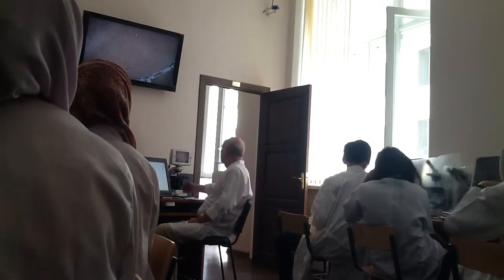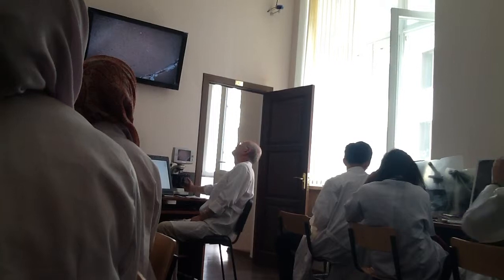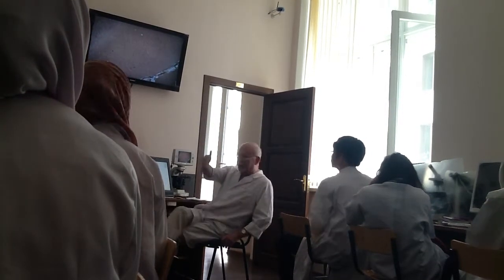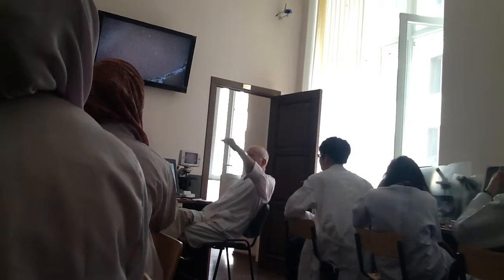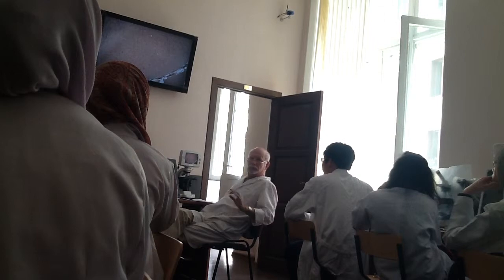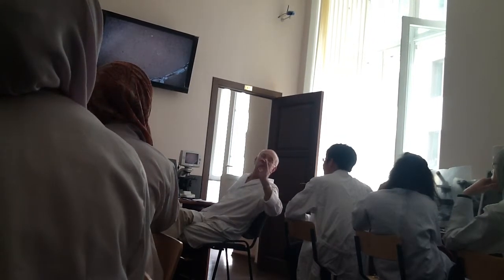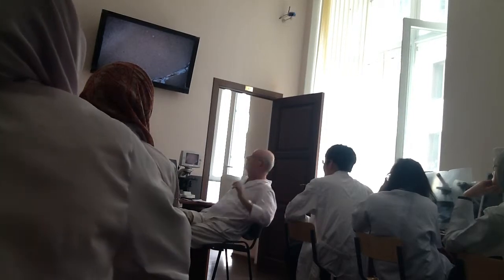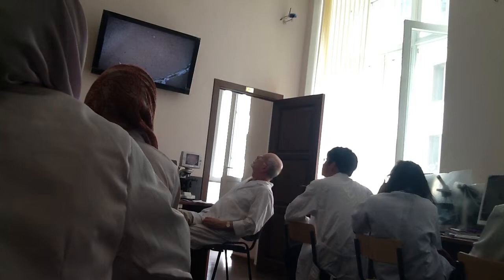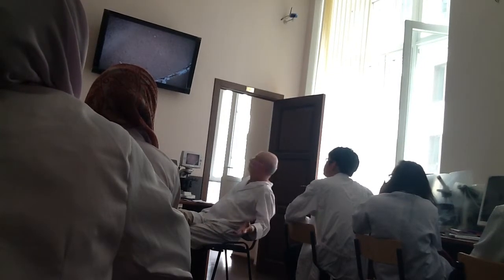Now, to differentiate the layers, we will change the order, not molecular, outer granular, no, another order. The algorithm of microscopy: first of all, the superficial layer, the outermost layer, molecular, easy to find.